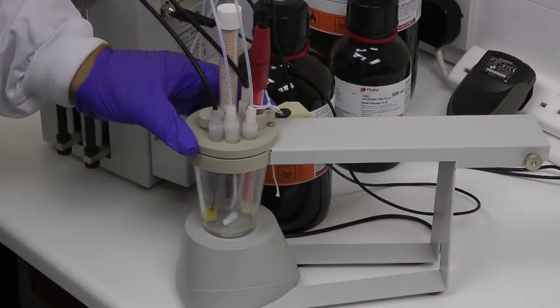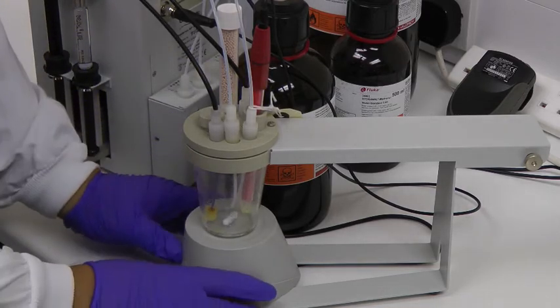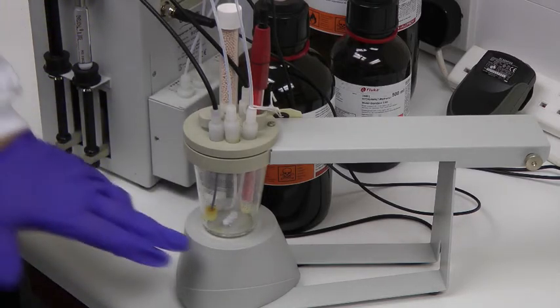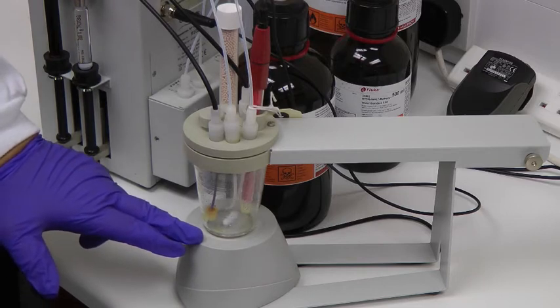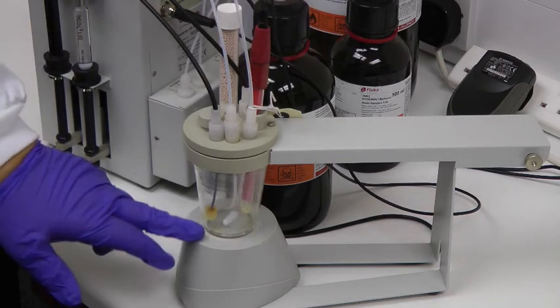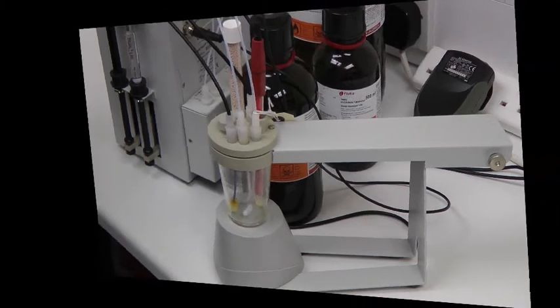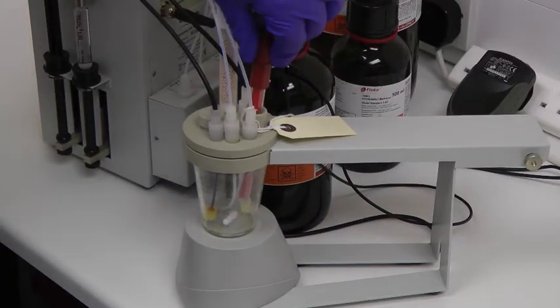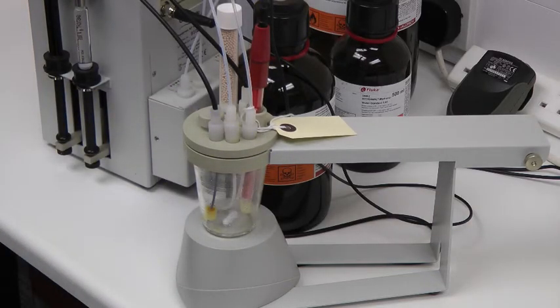The working part of the system is the titration vessel, which sits upon a magnetic stirrer. The positioning of the stirrer bar is very important — it must be able to move freely once the tubing and double platinum electrode are in place. Setting up the titration vessel is very simple: all of the components fit into recessed holes, and the vessel itself clips into the bottom to provide a firm fit.